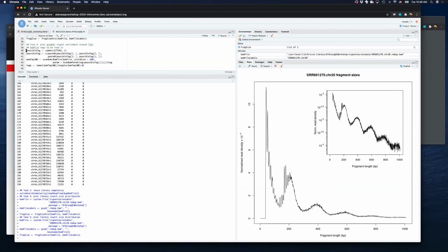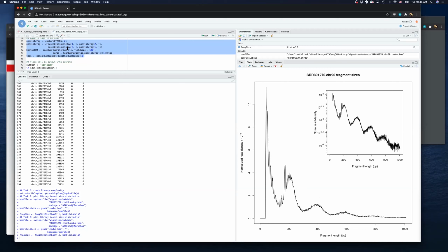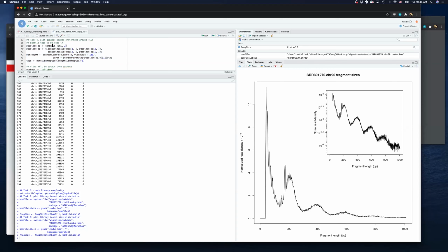This part, we just try to guess tags in your BAM file. If you already know, you can view your BAM file with some tools to know the tags. What should you import in the new BAM file? We include this part because we want to include as much information as possible in the output BAM file. Sometimes you will get an error when you use some tag that is not present in all reads, so you can just remove that tag.